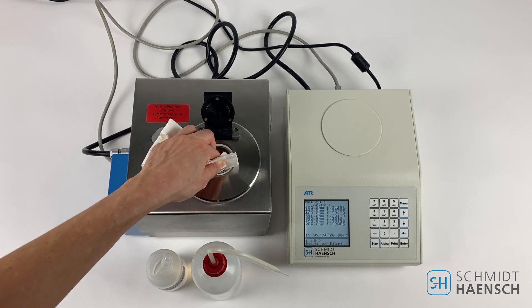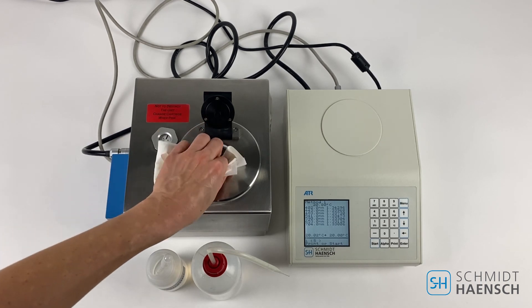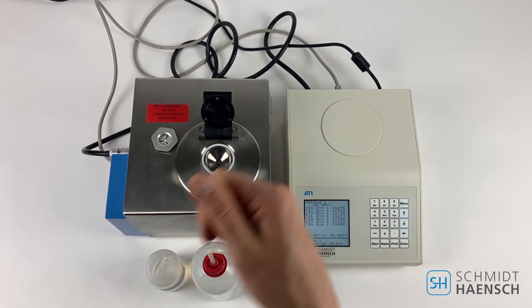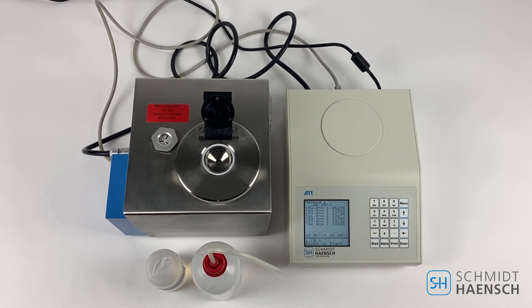Clean out the distilled water. Now you are ready to measure your new sample.